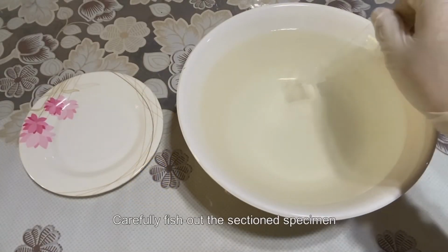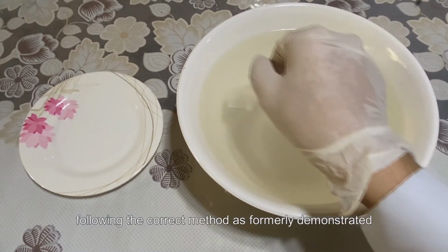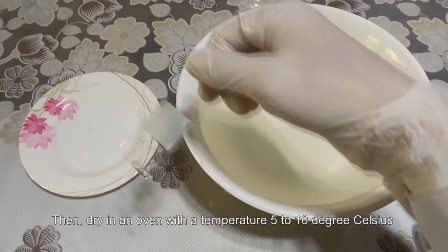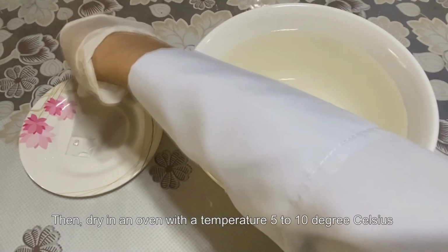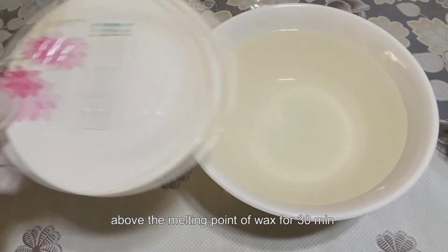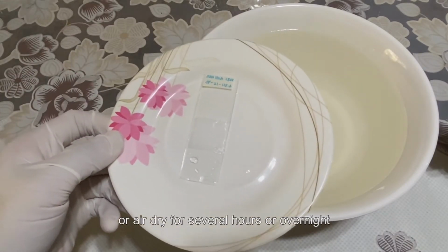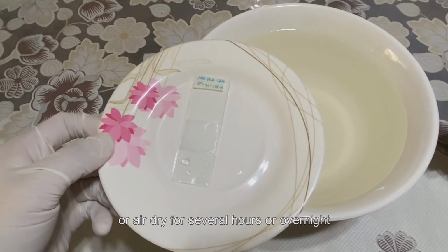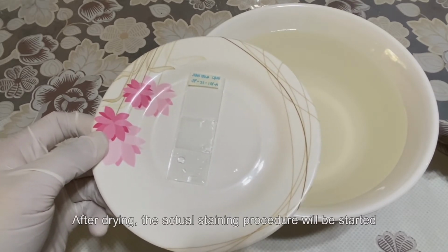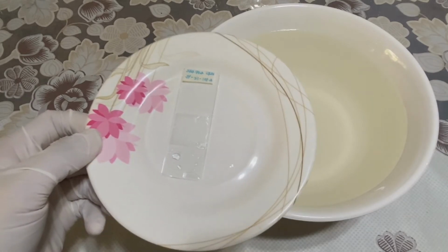Carefully fish out the section specimen, following the correct method as formerly demonstrated. Then, dry in an oven with a temperature 5 to 10 degrees Celsius above the melting point of wax for 30 minutes. Or, air dry for several hours or overnight. After drying, the actual staining procedure will be started.